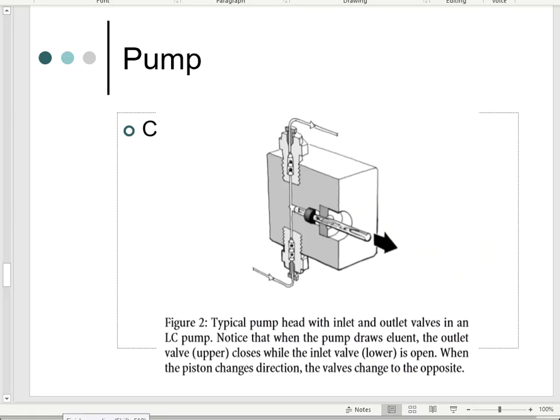Guys, in the last video, we talked about the pump, and we said the purpose of the pump is to pump your eluent through. And if you have this pump, and if it's running every single day for hours on end, you know as well as I do that pump is going to need some maintenance. So the last video, we walked you through how to take the front pump off, held on by just 4 screws, and then taking the pistons off of the back that just get screwed off, and then replacing some of those pump seals on the inside that prevent leakage. This is a cross section of the pump once it gets installed.